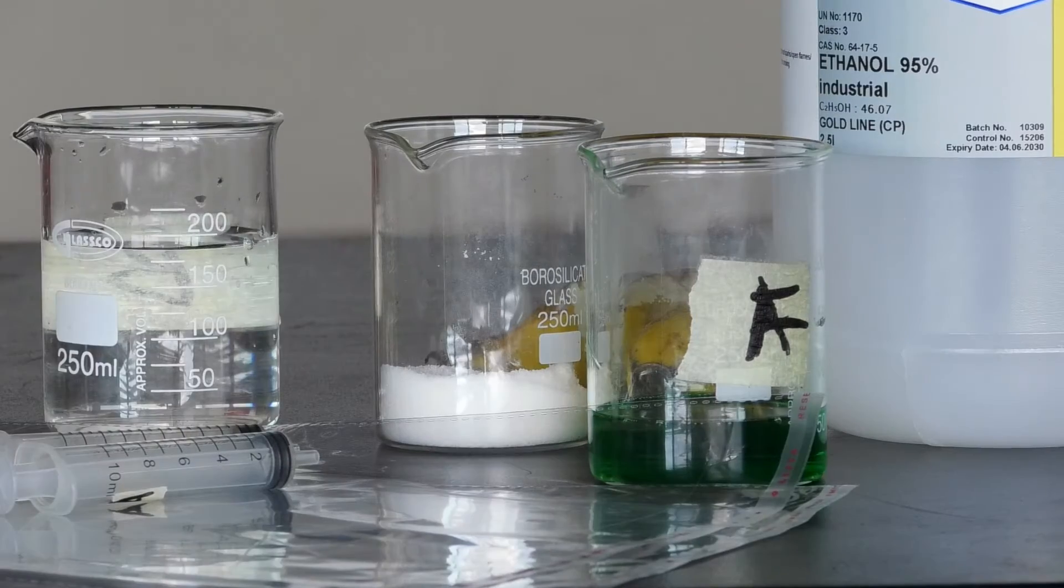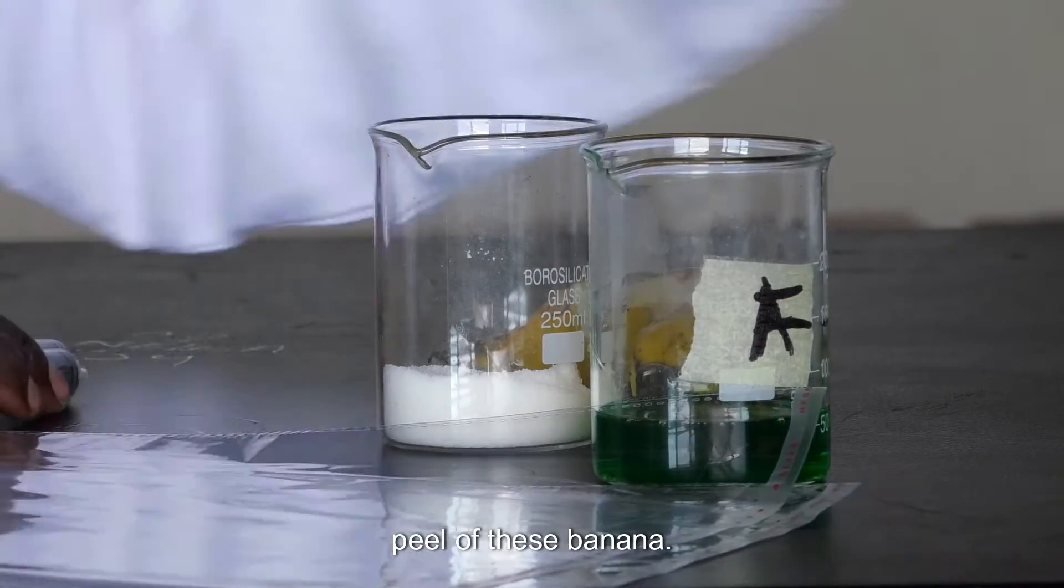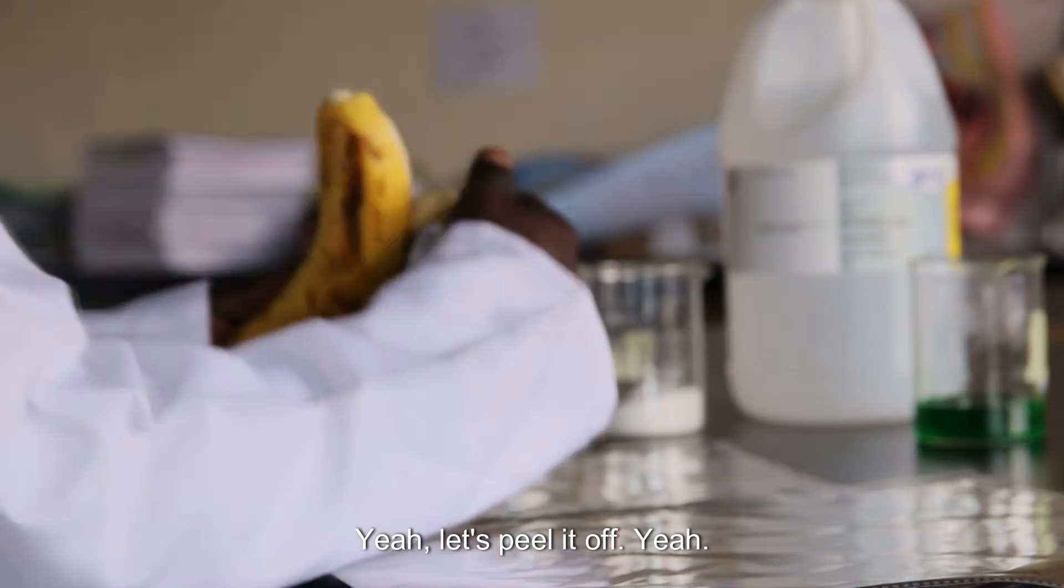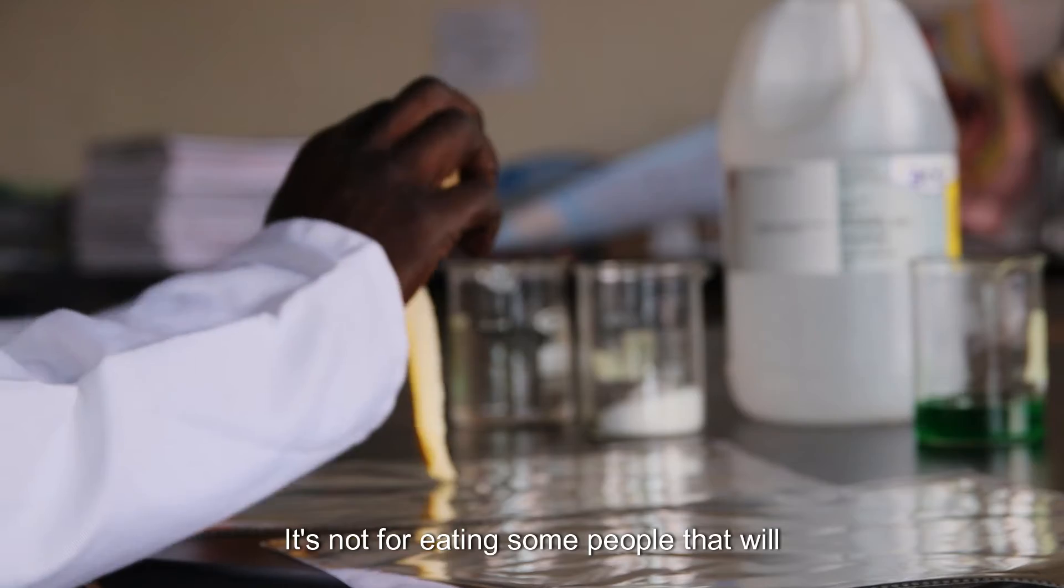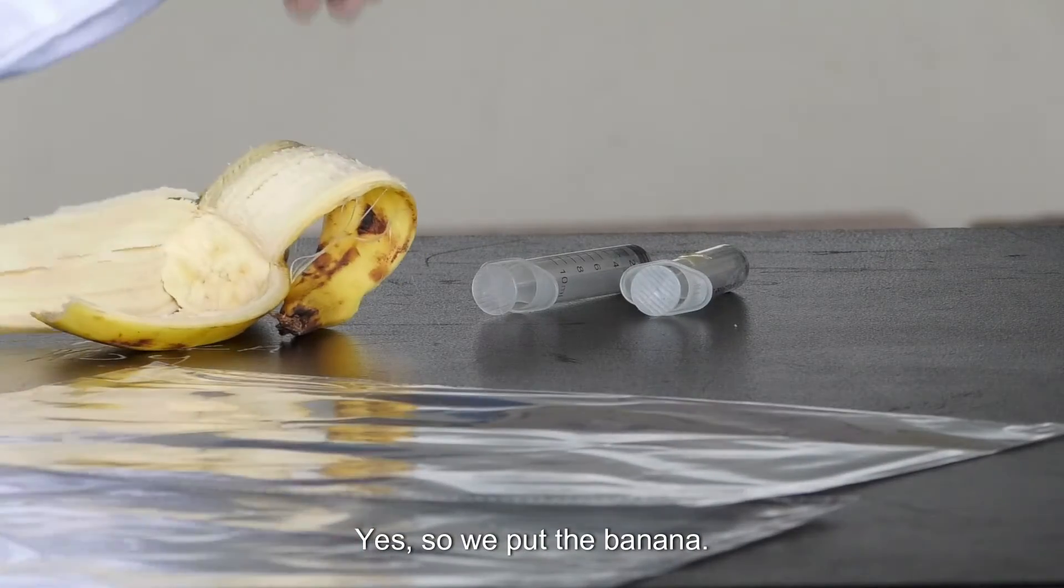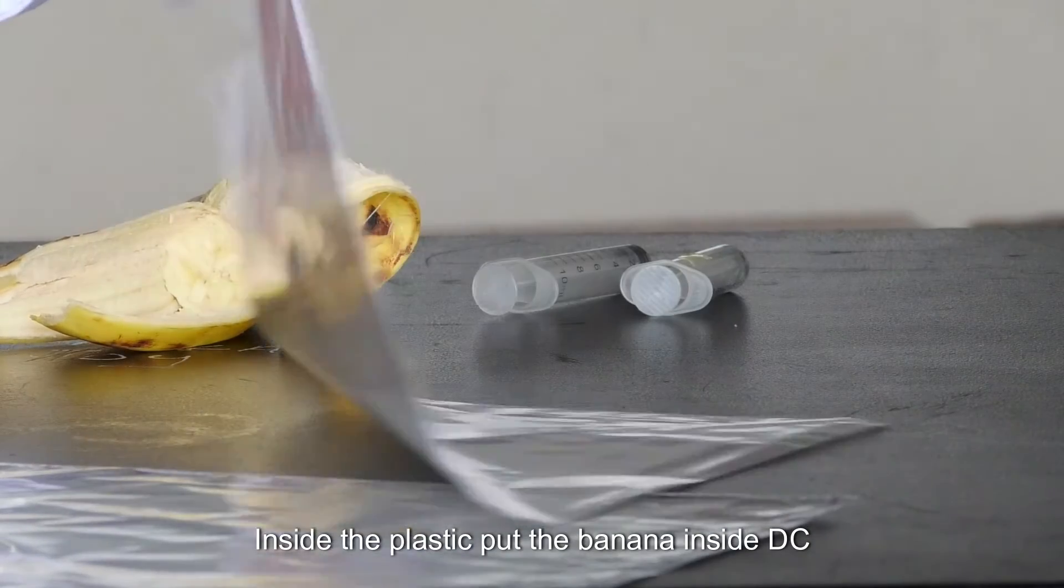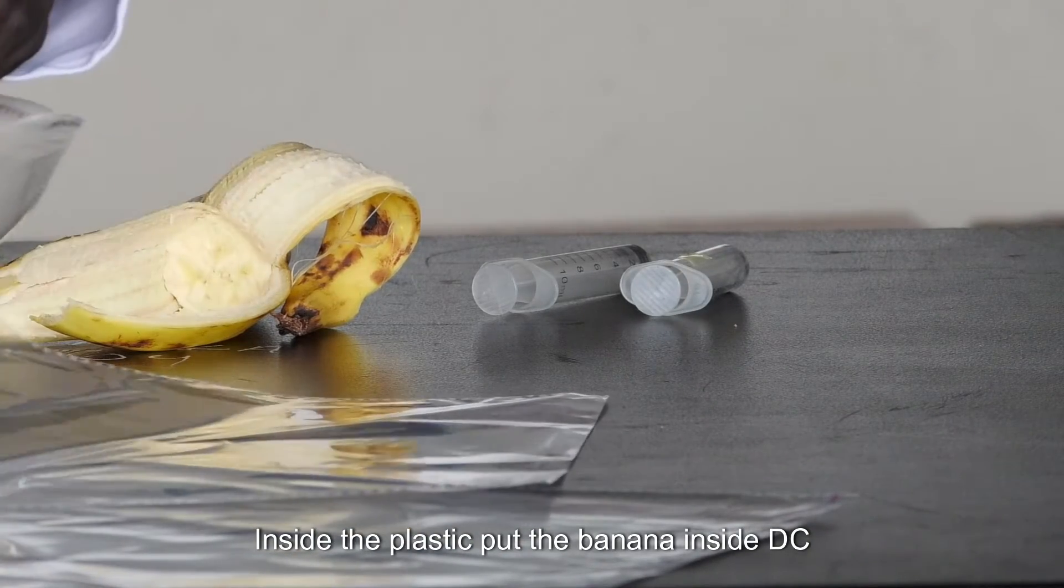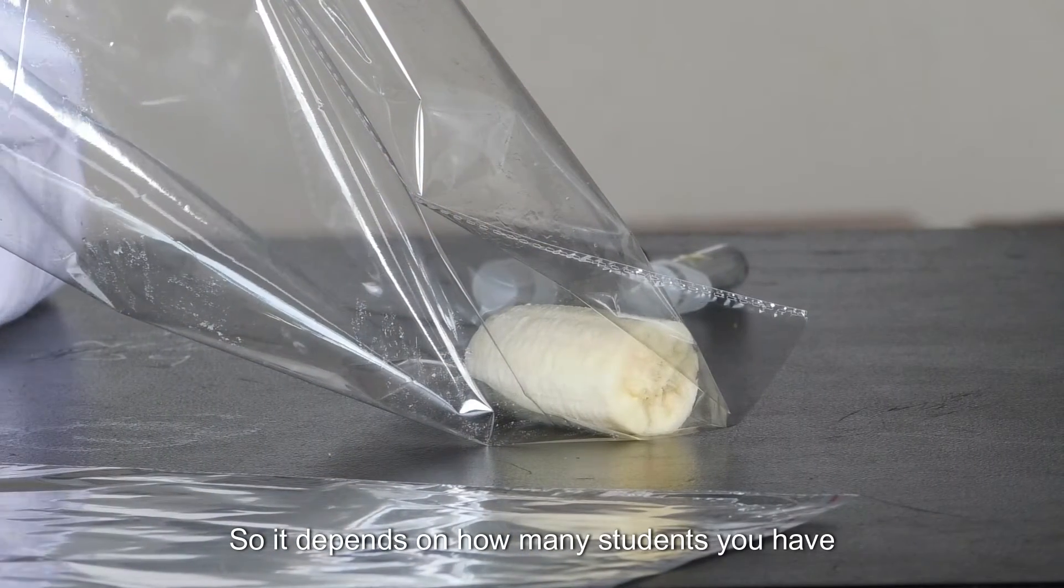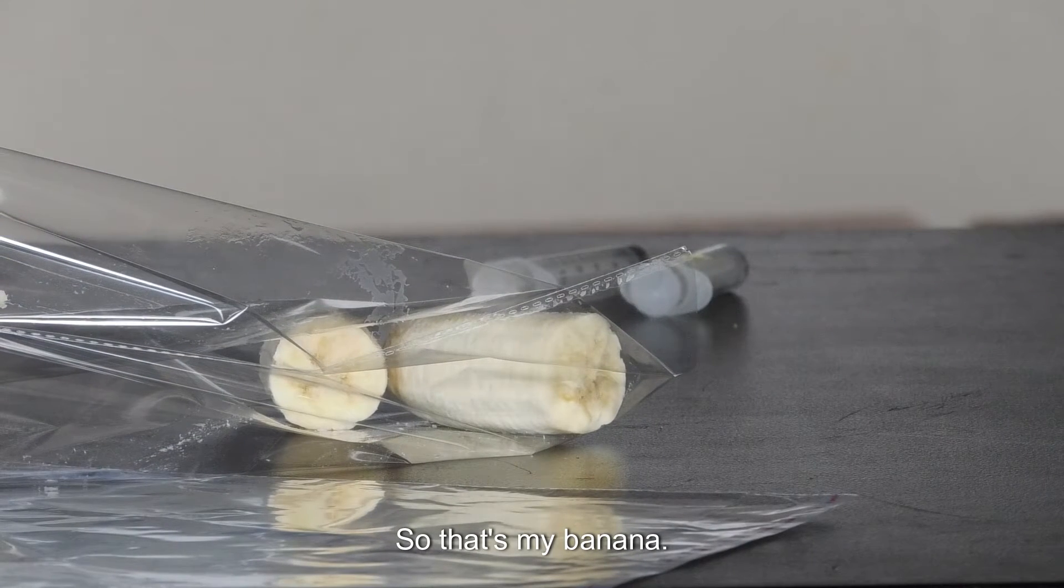So number one, what you need to do is to peel off this banana. Let's peel it off. It's not for eating. Some people will be saying yummy, yummy. No yummy here. So we put the banana inside the plastic. Put the banana inside this plastic. So it depends on how many students you have. That's my banana.